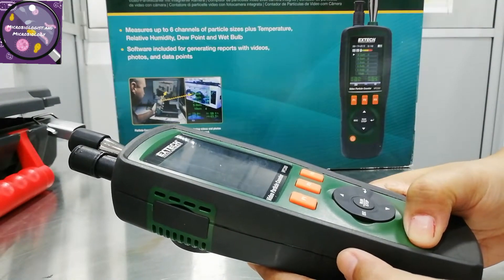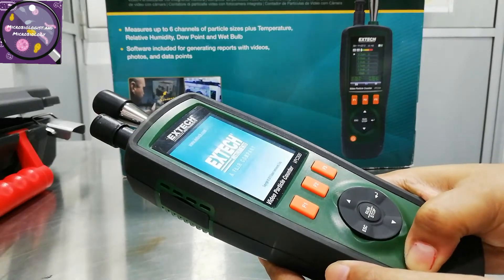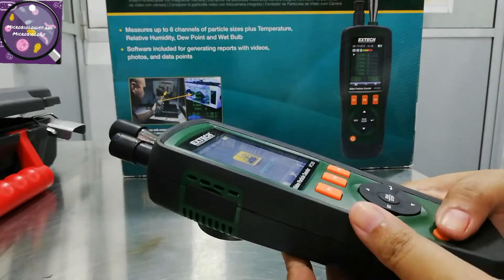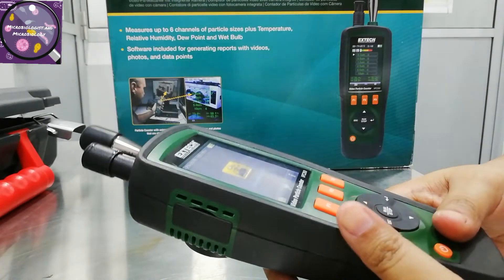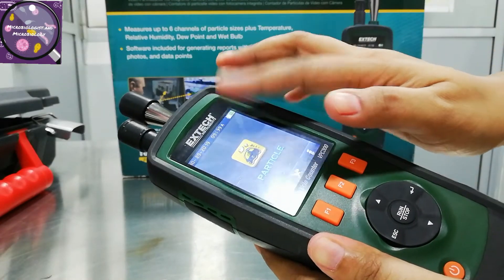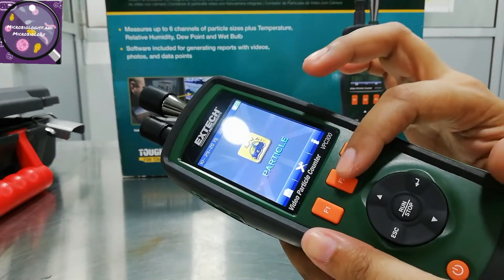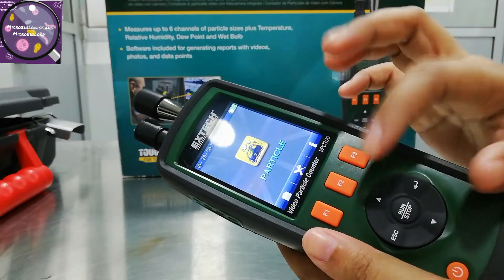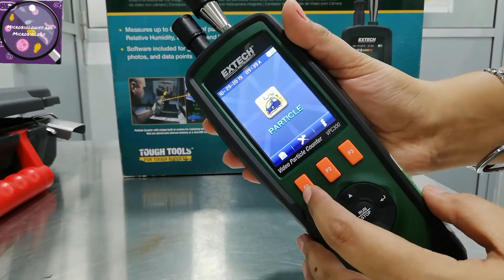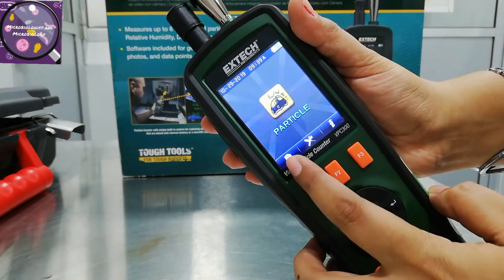Here I am pressing the on/off key, and after two to three seconds the device is on. You can see the time and date is already adjusted and set, and it is already charged.